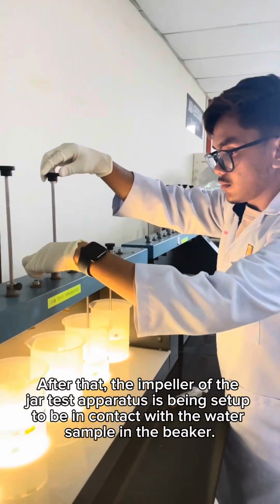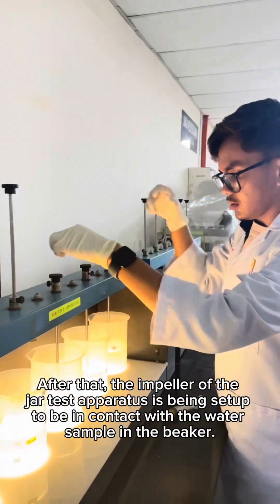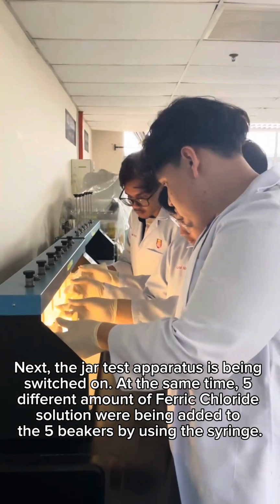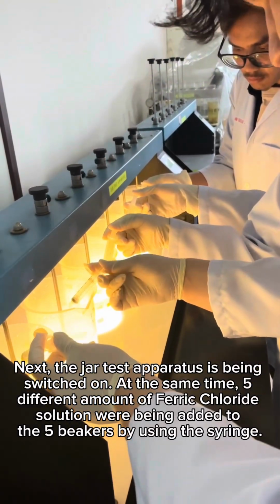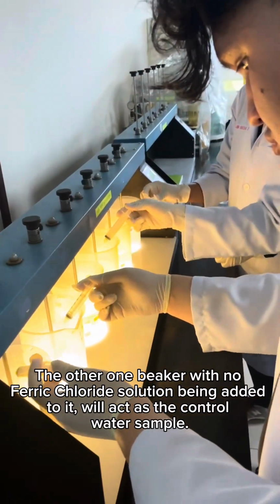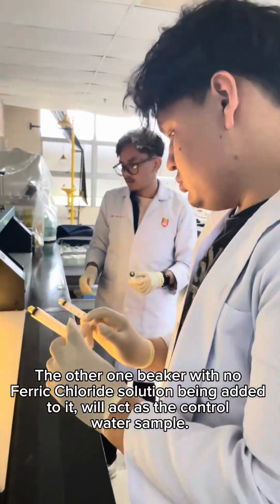After that, the impeller of the jar test apparatus is set up to be in contact with the water sample in the beaker. Next, the jar test apparatus is switched on. At the same time, five different amounts of ferric chloride solution are added to the five beakers by using the syringe. The other beaker with no ferric chloride solution added to it will act as the control water sample.